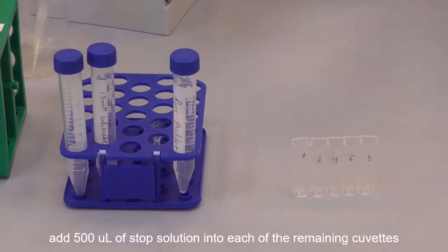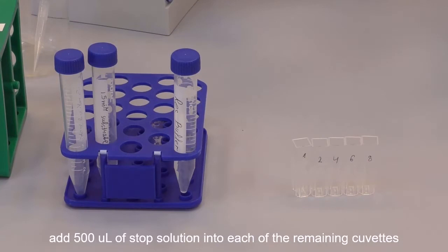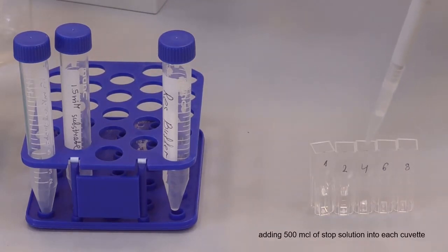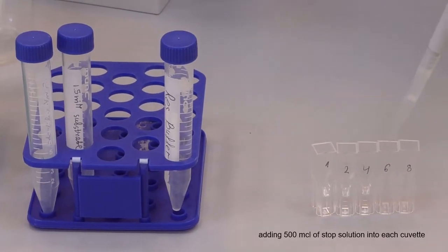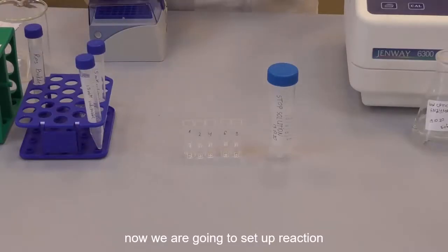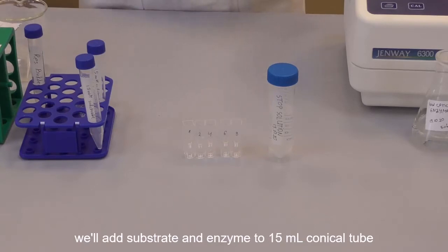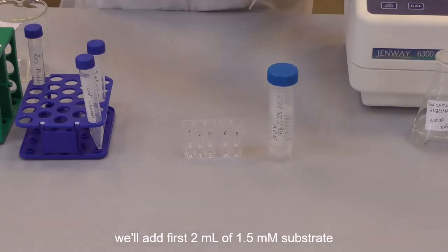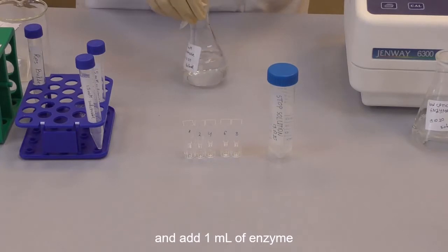Now add 500 microliters of stop solution into each of the remaining cuvettes. Now we are going to set up the reaction, and for that we will add substrate and enzyme to a 15 ml conical tube. So we first add 2 ml of 1.5 millimolar substrate and then add 1 ml of enzyme.